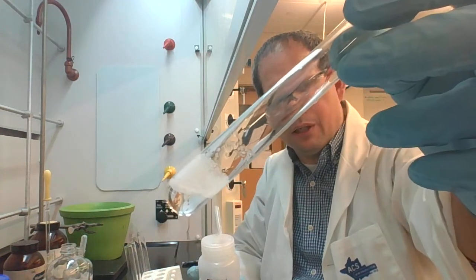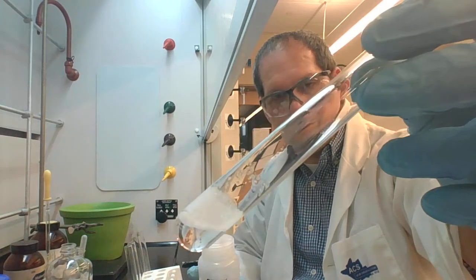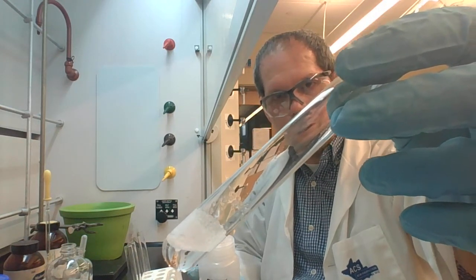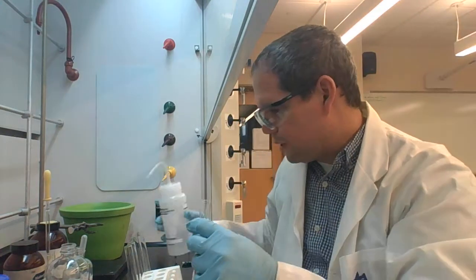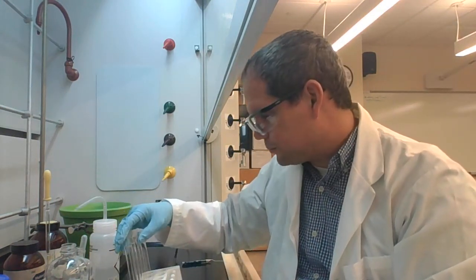In fact, fluorene floats at the top, so they definitely do not dissolve with each other, and they form basically 2 layers. So the water forms the bottom layer, and then fluorene just floats right on top of the water. They definitely do not want to dissolve, so this is completely insoluble.